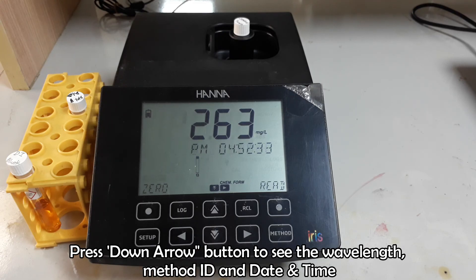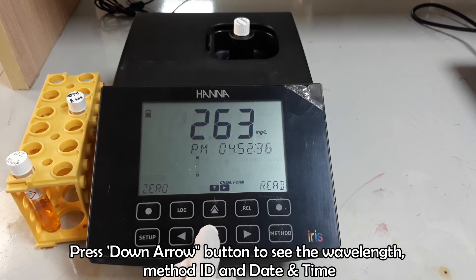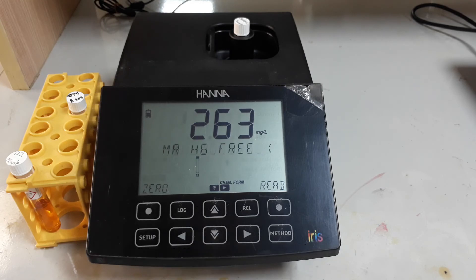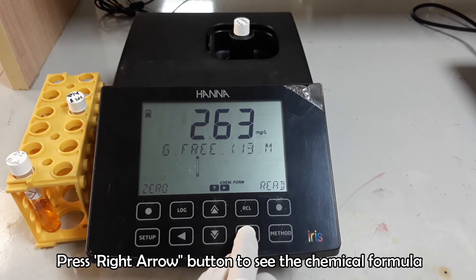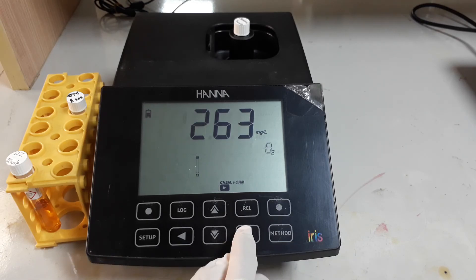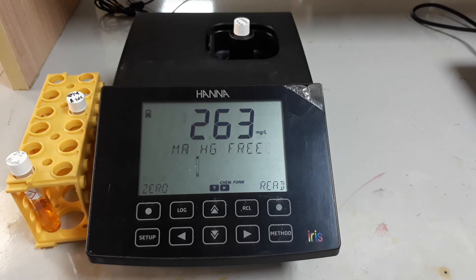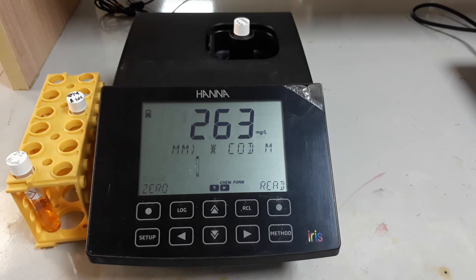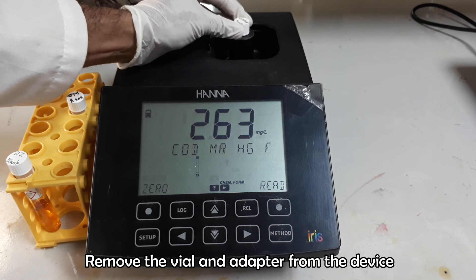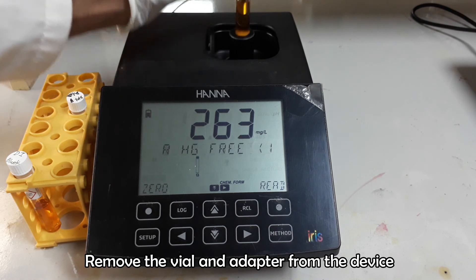Press the Down Arrow button to see the wavelength, method ID, test date and time. Press the Right Arrow to see the chemical formula. Remove the vial and adapter and shut off the instrument.